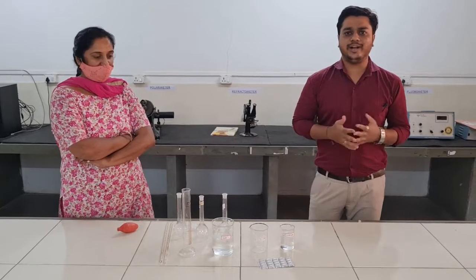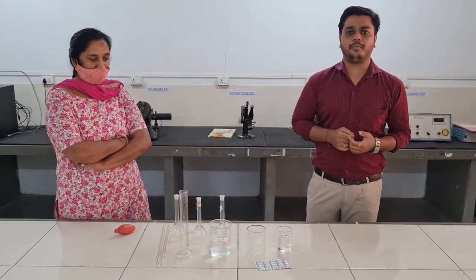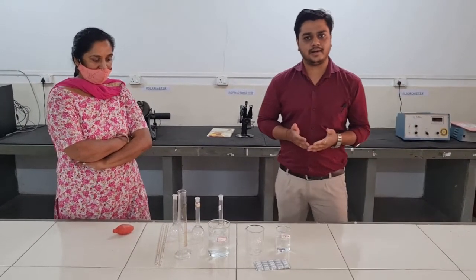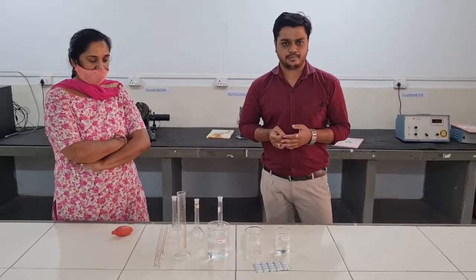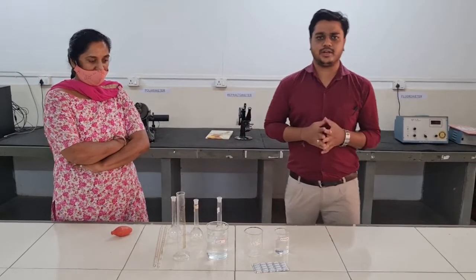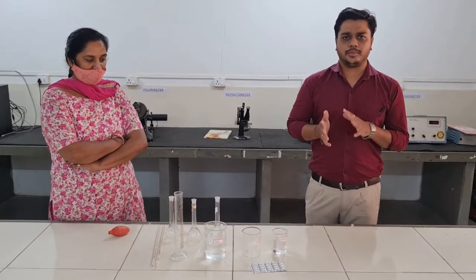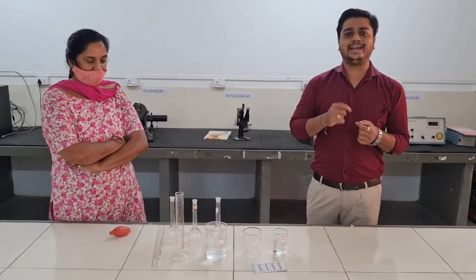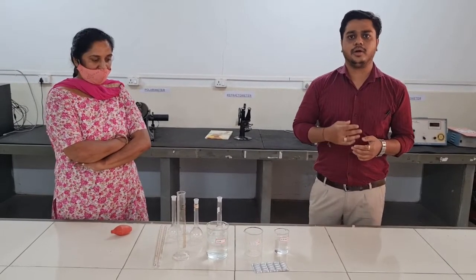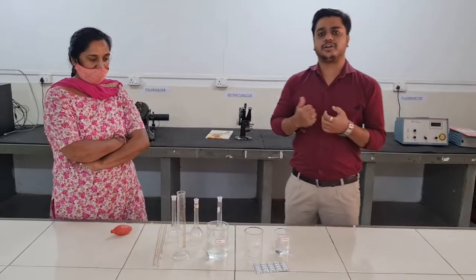The aim of today's experiment is to perform assay of Paracetamol tablet as per IP 2007. According to the procedure, first of all we have to take 20 tablets of Paracetamol, weigh and crush them.